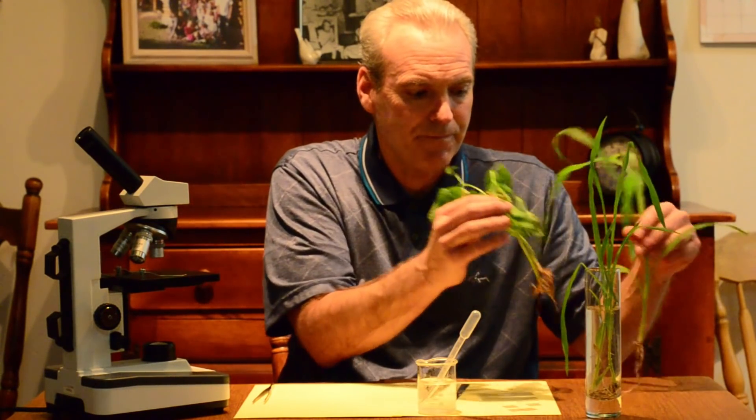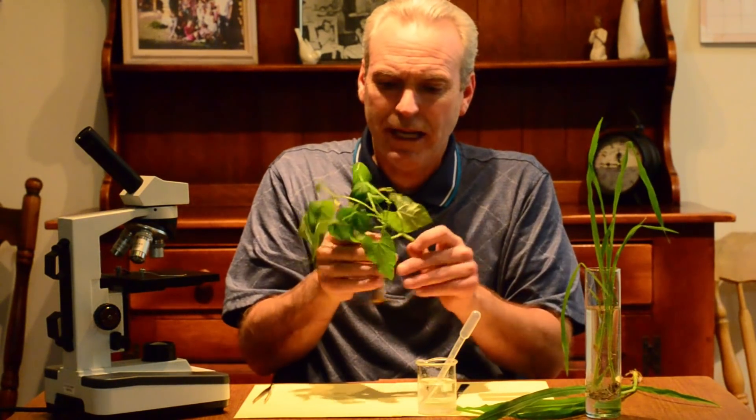So plants are fascinating creatures. So today in class, when we're working with the plants, what we want to do is literally kind of disassemble the plant, looking at its pieces and parts. And so I have the two plants that we'll be working with. I have the corn plant and our bean plant. I'm just going to take out our bean plant and look at that really quickly.